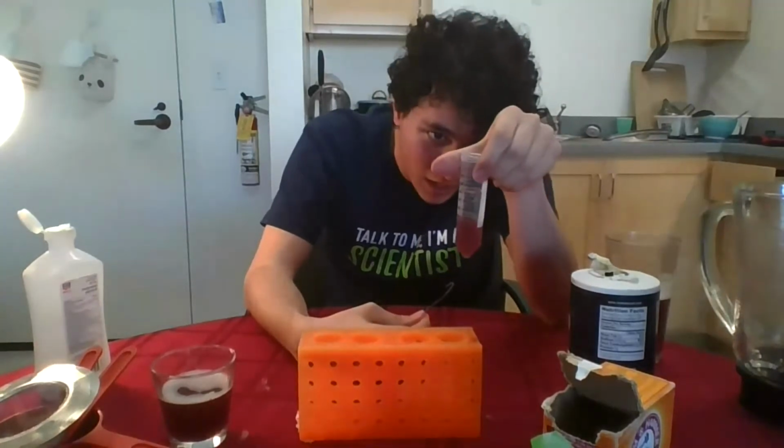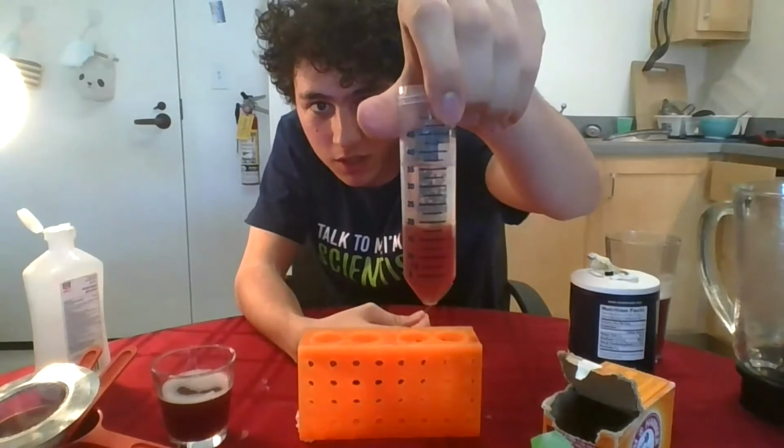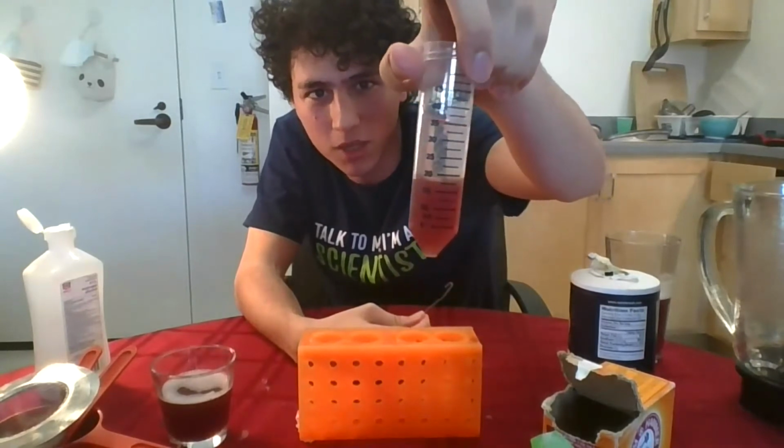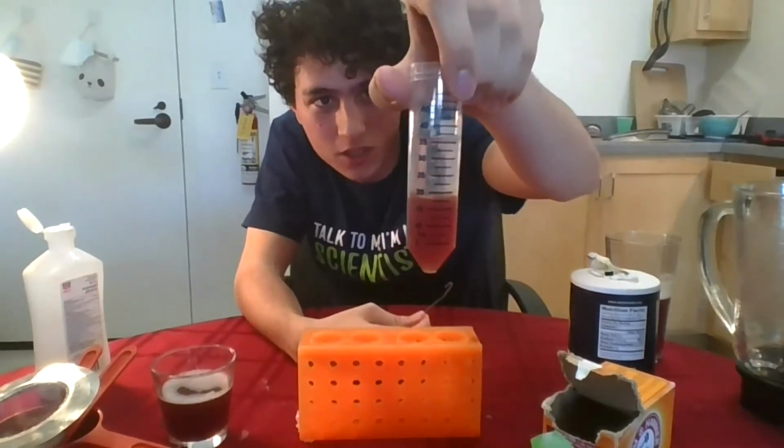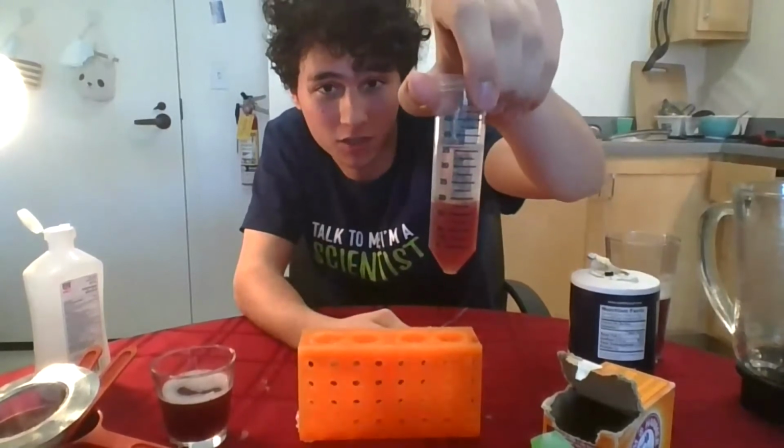In this case, I think it came out in chunks, so you can see there are all these white chunks floating. Can you guys see it? Matthew, perhaps? Yeah, you can see it. So those white chunks, which are too small for me to grab with this hook, that's the DNA that came out of the strawberry blend.